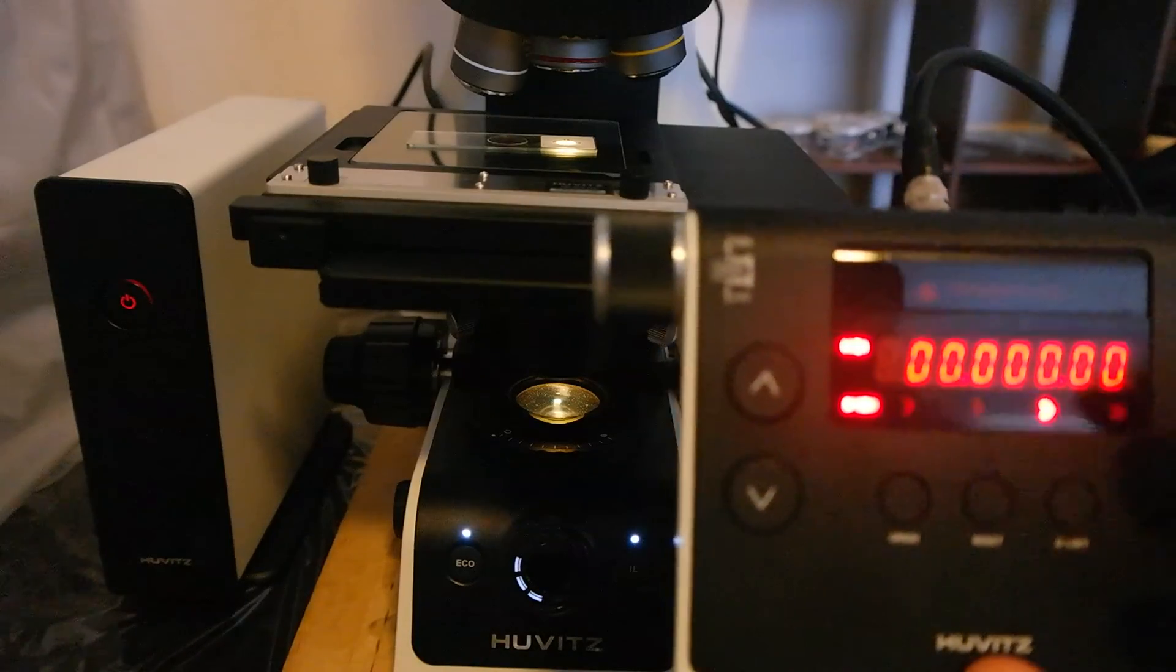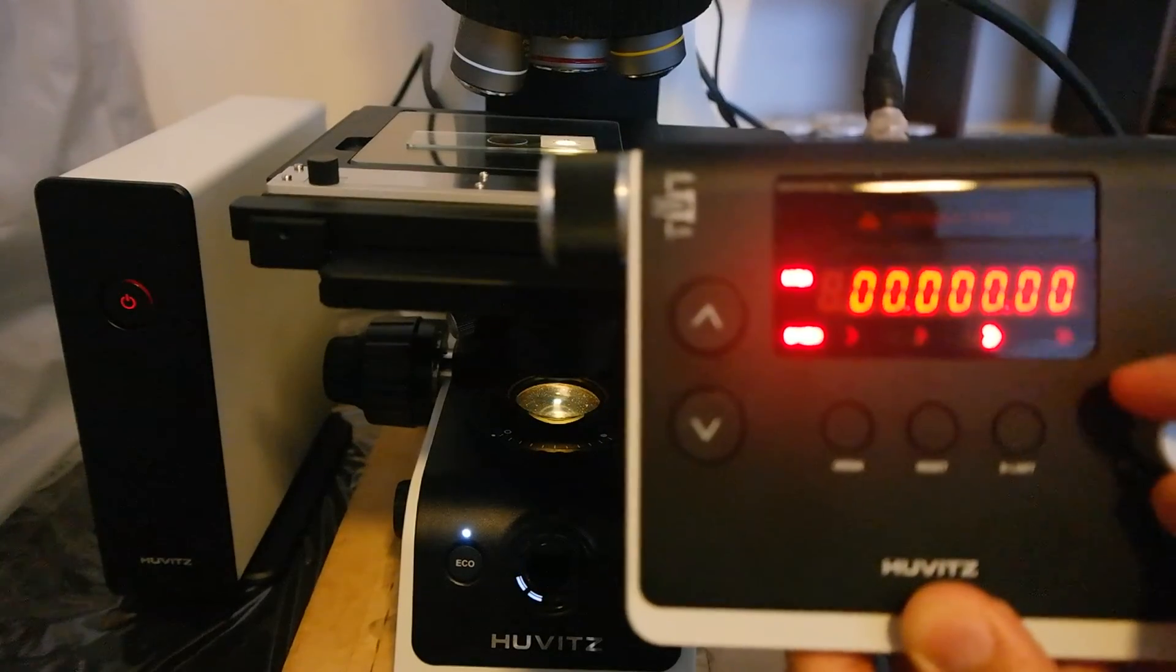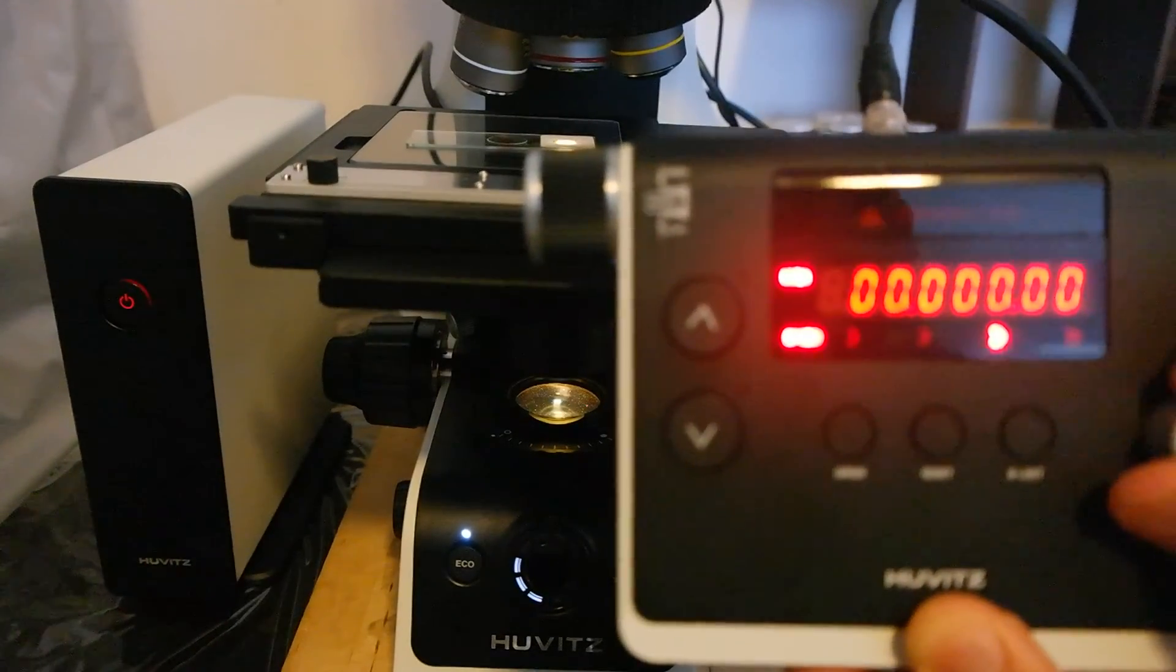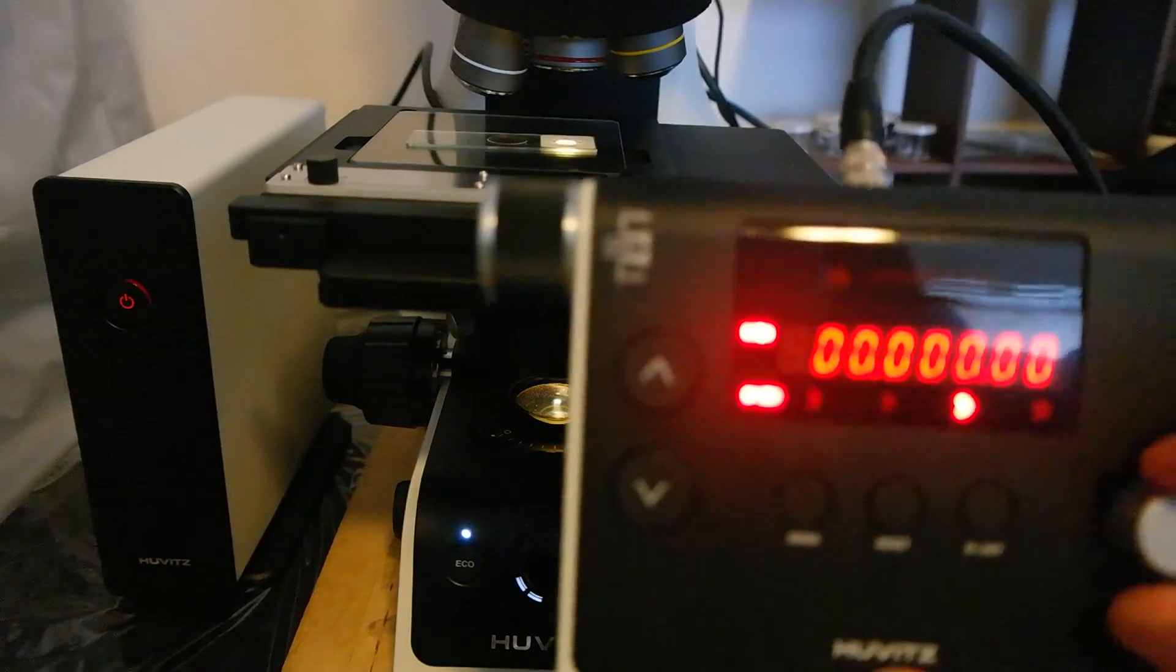What happens here is you can change the light from here on the pad as well. So while you are working on the computer and you need to adjust the light intensity, you can use this pad again.